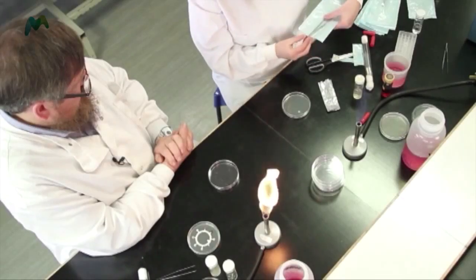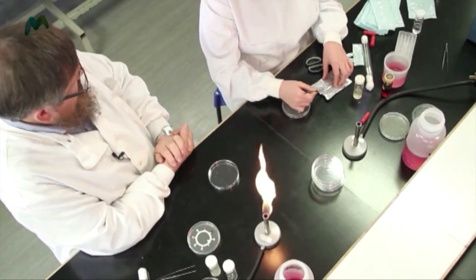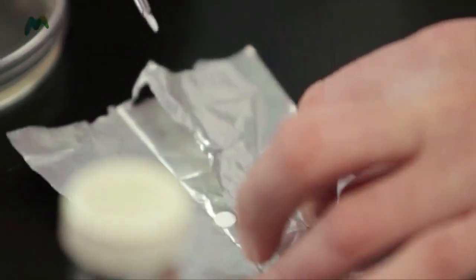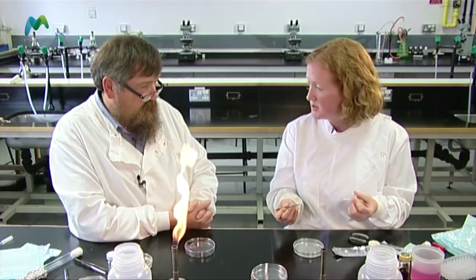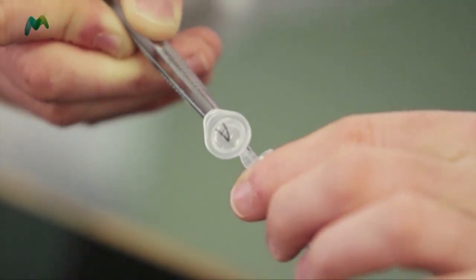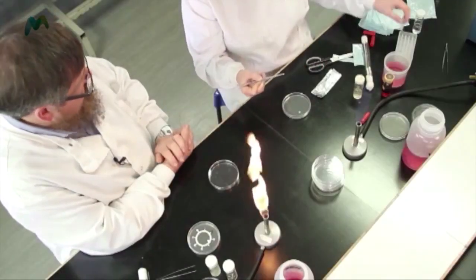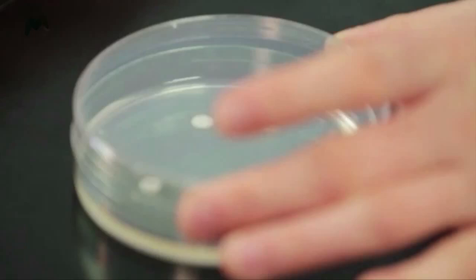This time we're using ampicillin — an antibiotic that maybe you've been prescribed by a doctor. We've just made it up for lab use in liquid form at the working concentration. I'm going to infuse it into the disc — very carefully dipping the disc in. I'm not completely waterlogging it, just dampening the disc. I'm going to put it a suitable distance away and place it onto the agar plate.